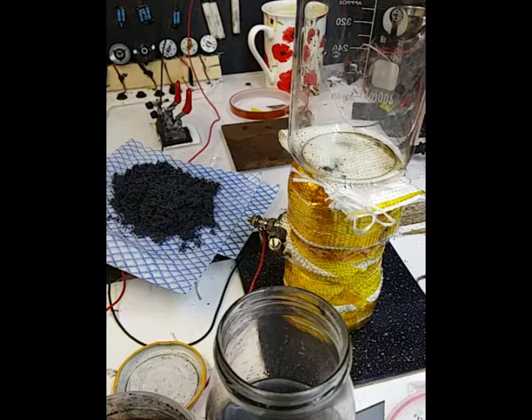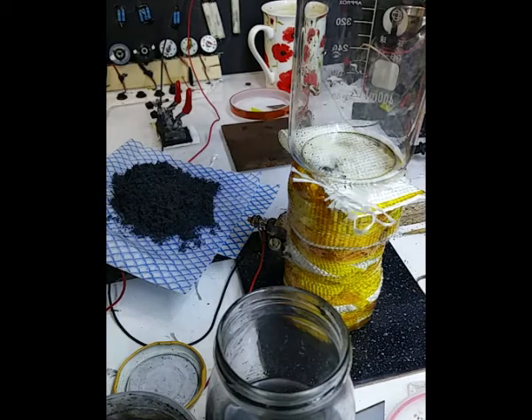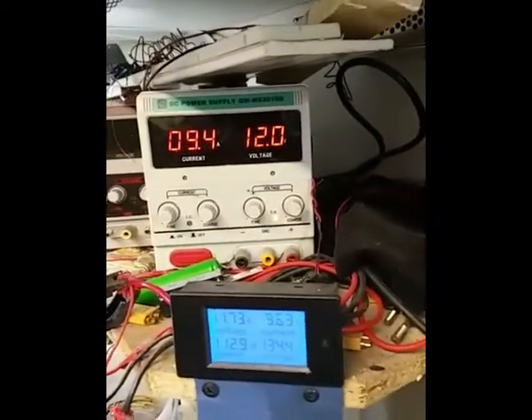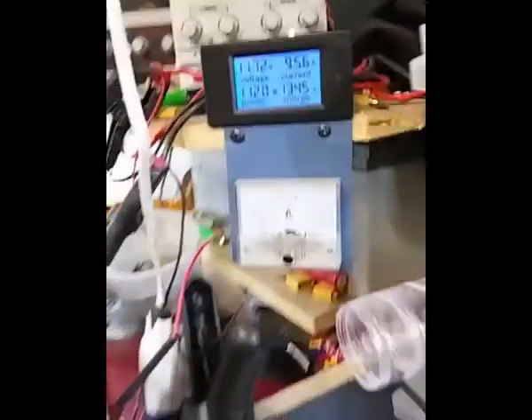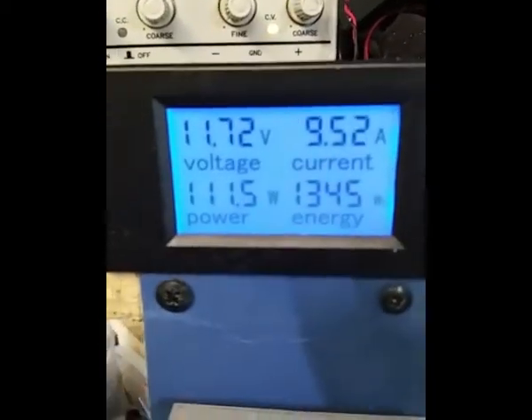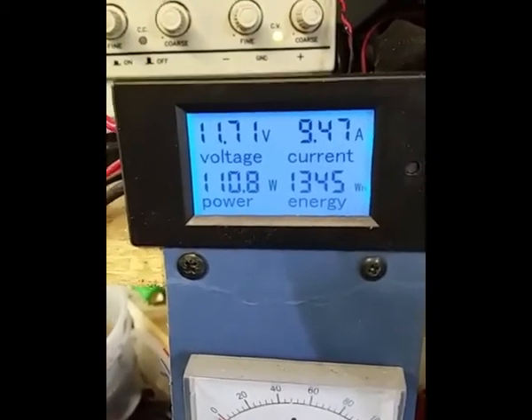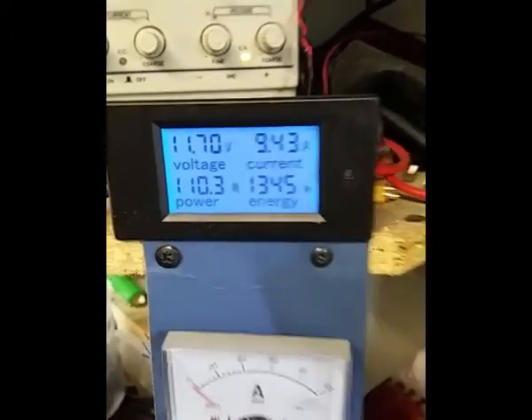The voltage is still 9.5 and the current is 7.8. Now I'm guessing I could turn the volts up a little bit there. Okay, I've turned them up to 12 volts and we got 9.4 amps, look. And that says 11.72 volts at 9.5 amps. 110 watts.